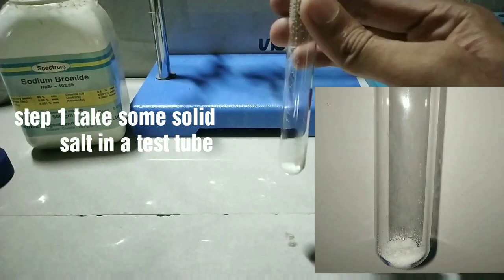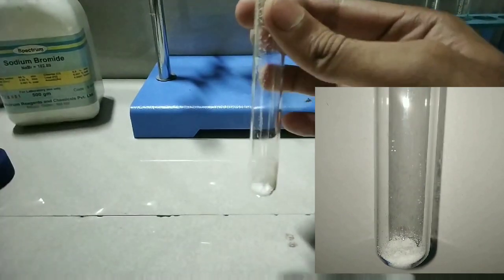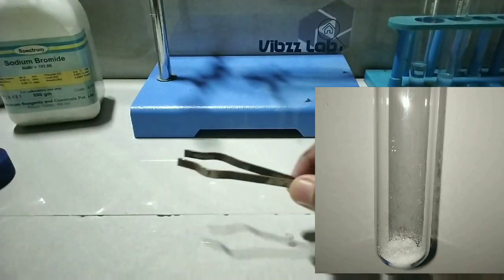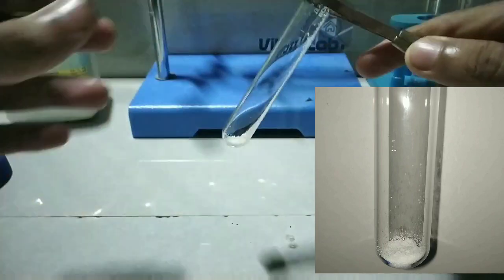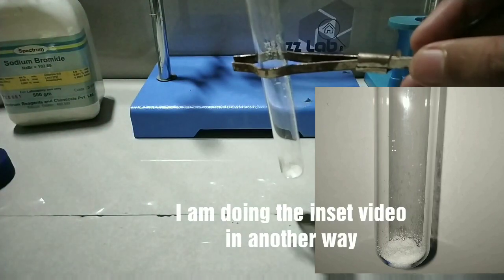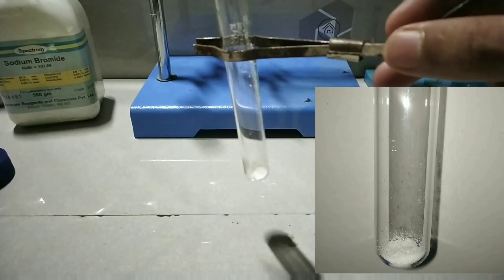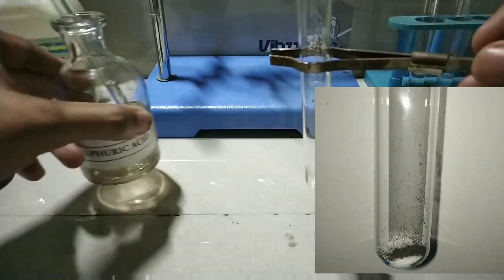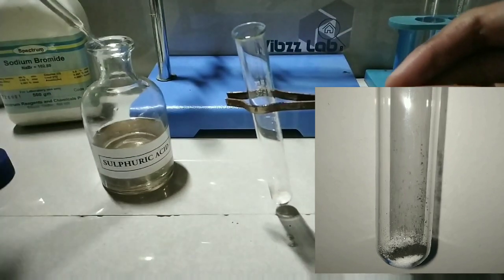For the concentrated sulfuric acid test, I have taken the solid salt in the test tube and now I will be adding concentrated sulfuric acid. Since the acid is corrosive, I am using a test tube holder and a dropper to add the acid. In the inset, I have already added manganese dioxide.